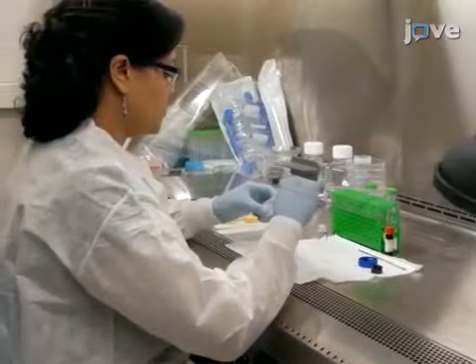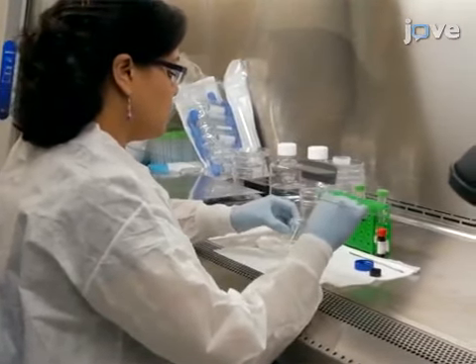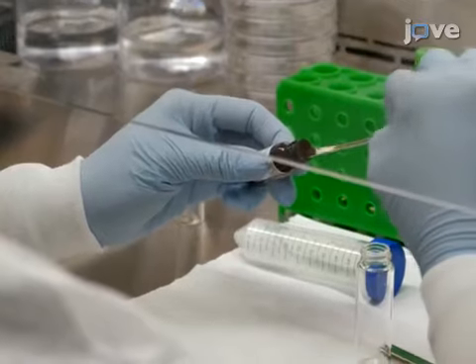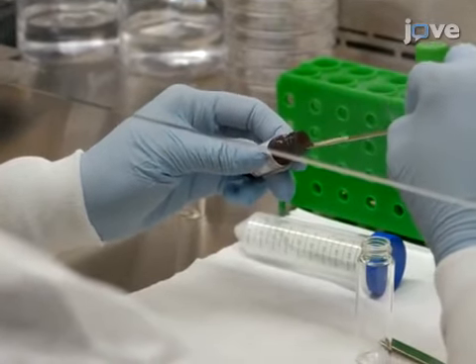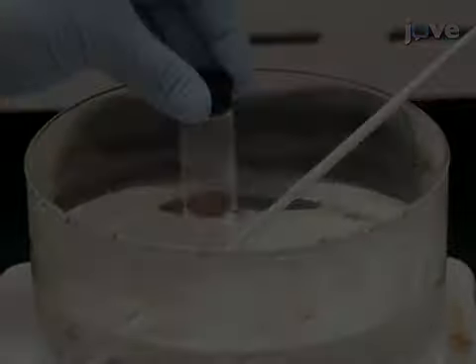To synthesize the SLNs, combine 0.6 mg of fluorescent dye or other lipophilic compound and 0.10 grams of the linear alkane or lipid in a 15 ml vial. Co-melt the components at 90 degrees.